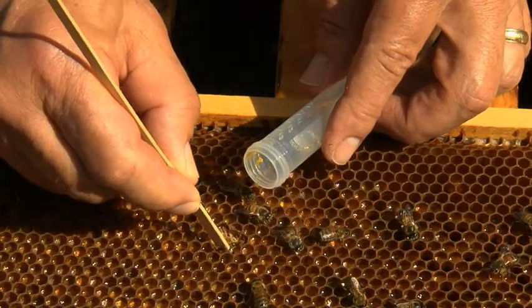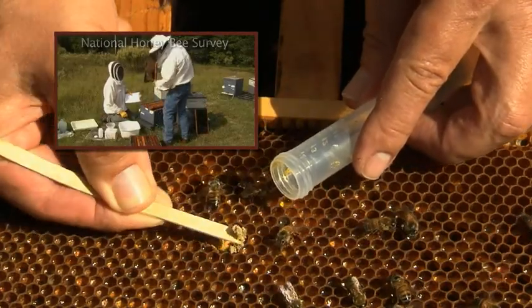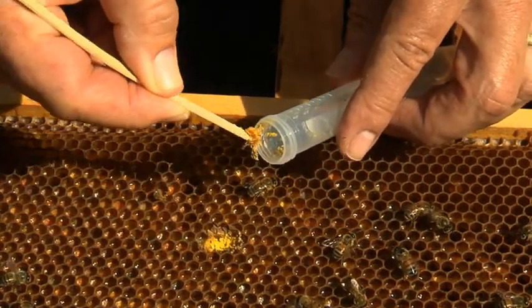Sampling pollen will occur concurrently with the USDA National Honeybee Pest and Disease Survey demonstrated in another video. This protocol is a supplement to those initial sampling descriptions.